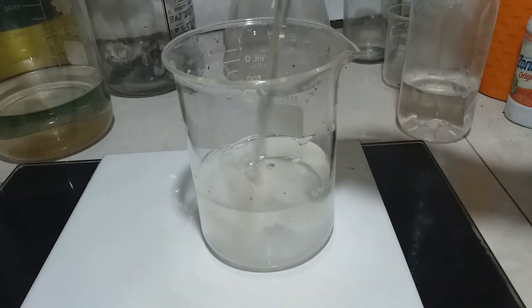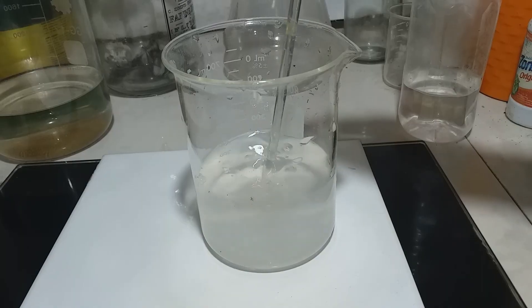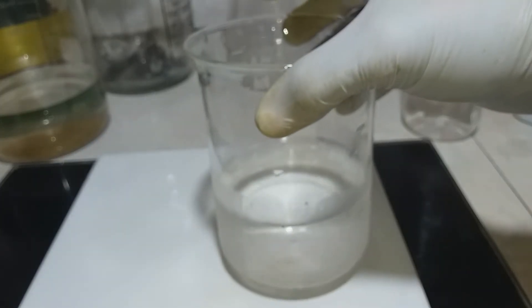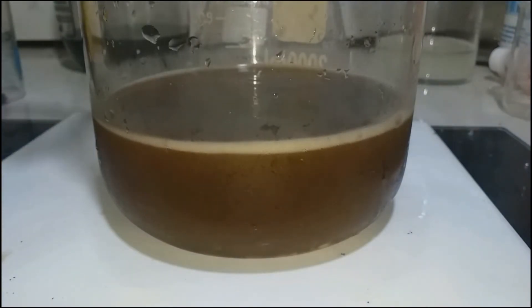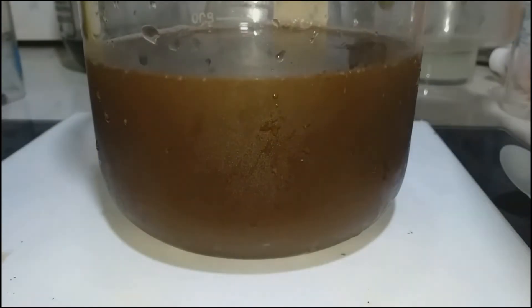Stir it, and after you dissolve the urea in distilled water as you can see here, then pour it into your aqua regia solution and your precipitation to completely kill the nitric acid and reduce the acidity, including hydrochloric acid — add the water with dissolved urea to your precipitation so that you kill excess chemicals or acids and reduce acidity. That is the reason.